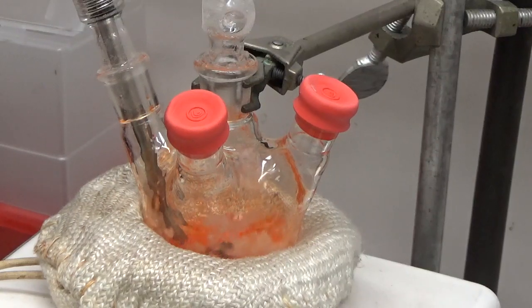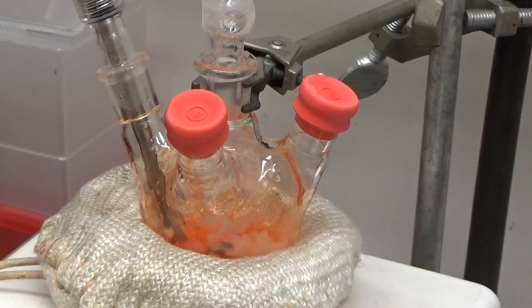You can see a bubble and it really takes a long time - that's the hexane very, very slowly coming out.